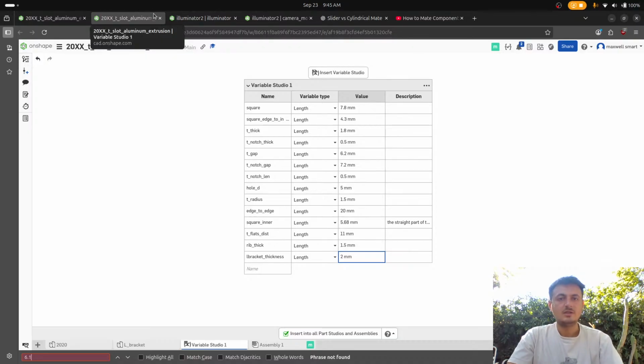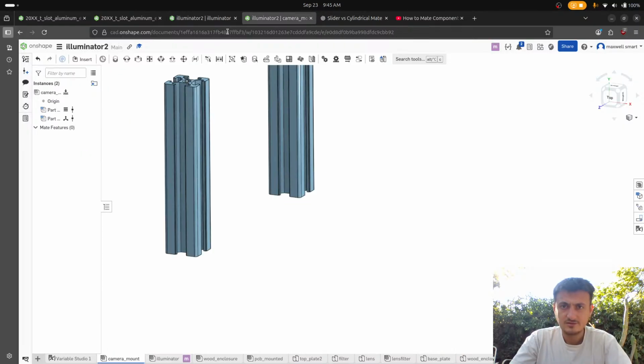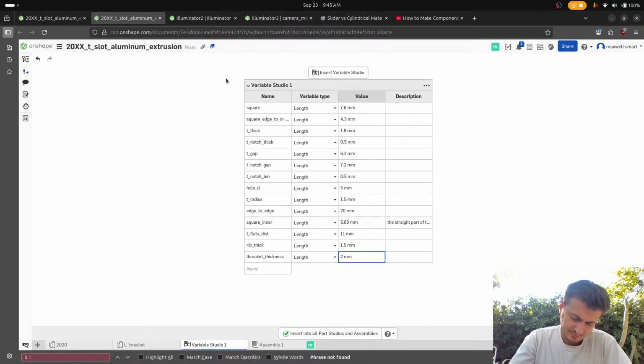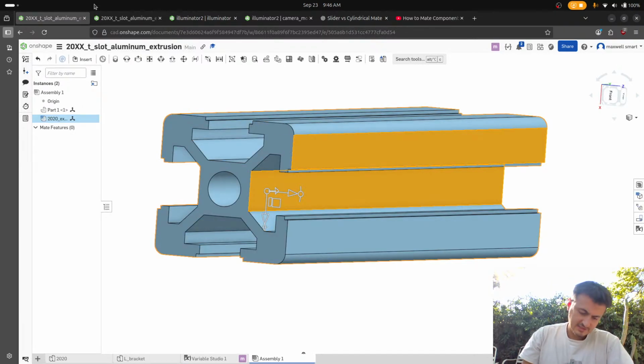Okay, so we need to just make a new variable. It's gonna be the square edge. It's gonna be the 4.3 plus the 1.8. So square edge to T outer edge. I don't know what that means, but like distance, I don't know. So this is going to be the 4.3, which is square edge to inner, plus the 1.8 T thick. Okay. But that's not the way that I want to do it.